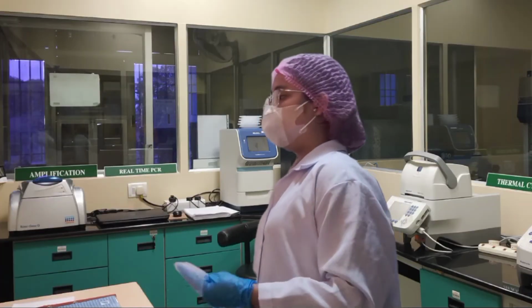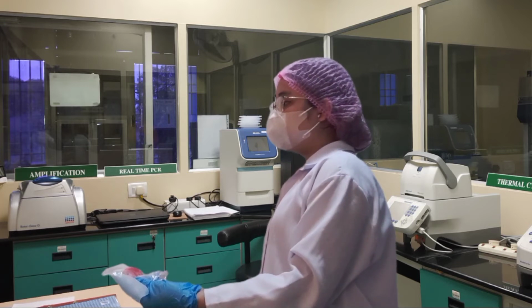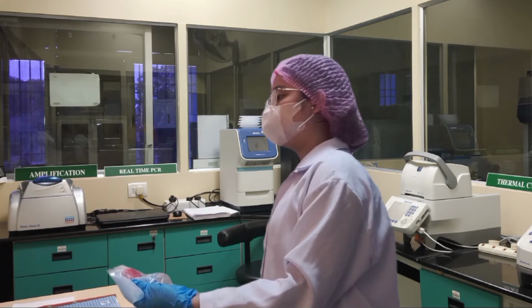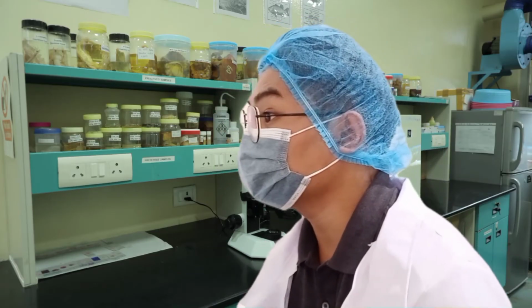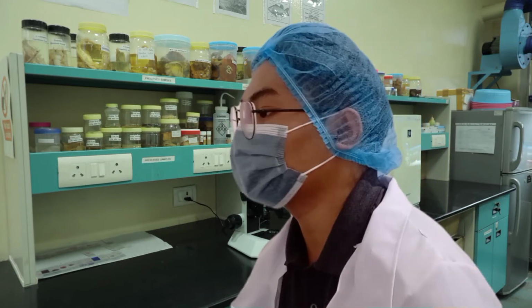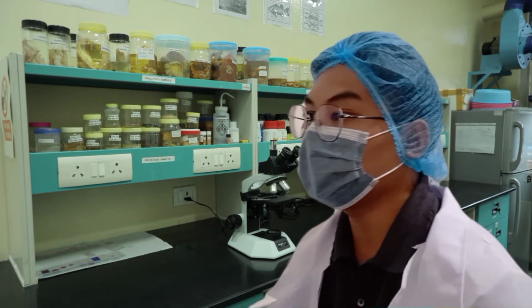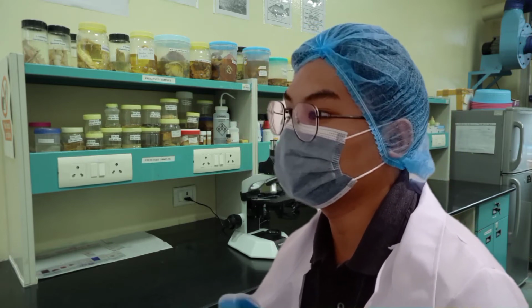Unfortunately, Ms. Rupido, I will have to reject this sample. Please discard this specimen into the infectious waste bin and collect a new one from the patient. Please make sure that the specimen container is labeled correctly and matches the patient's requisition form. Also take note of the missing hospital number on the requisition form. And thank you. Alright, Ma'am Mendoza. These are all noted po and I'll get back to you as soon as possible.